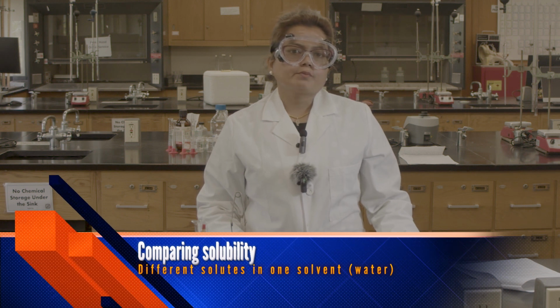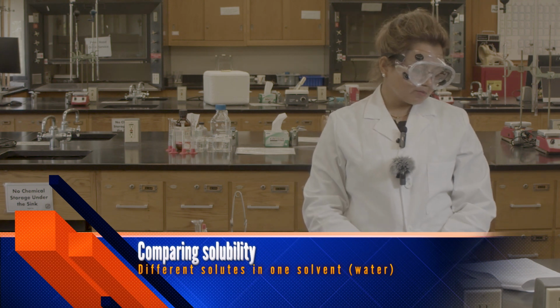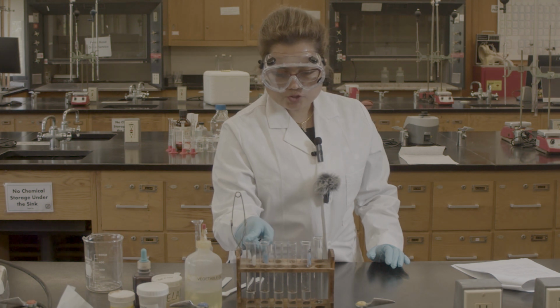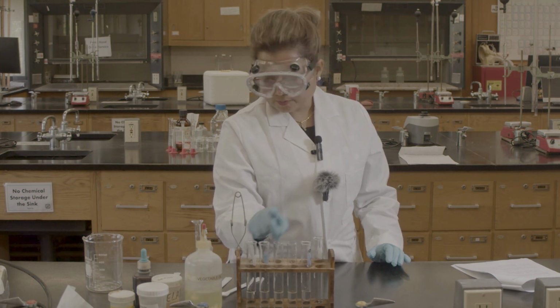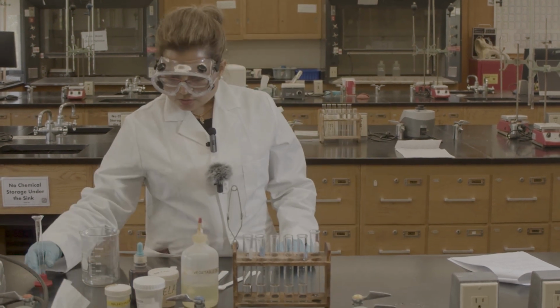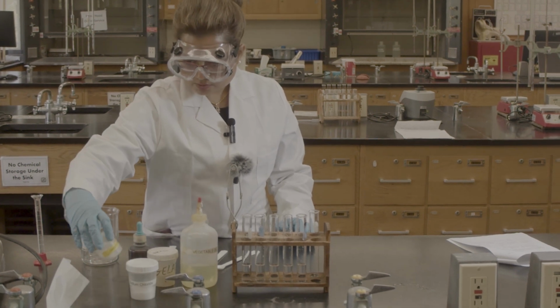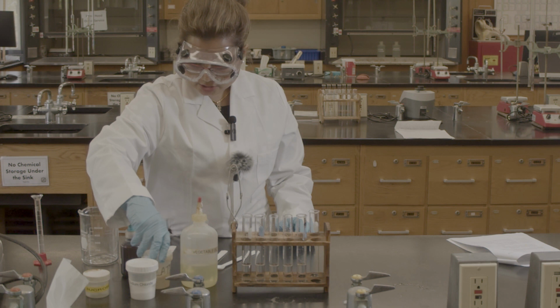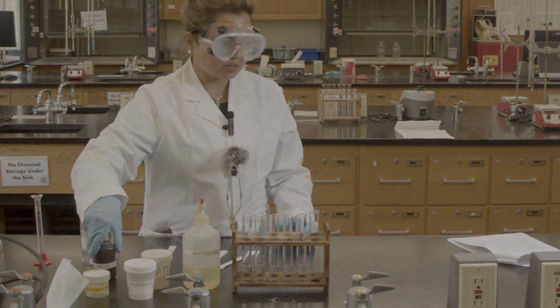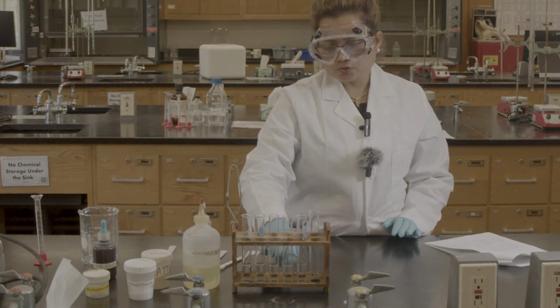Now we are moving to part 2 and group 2. Group 2 says comparing the solubility of different solutes in water. I have 5 test tubes with 5 milliliters of water. I'm going to use different types of solutes in here. So we have sodium chloride, sucrose, gelatin, oil, and also the iodine solution.